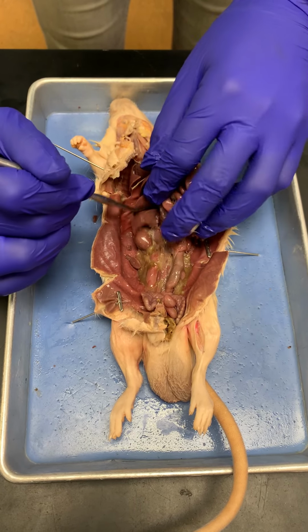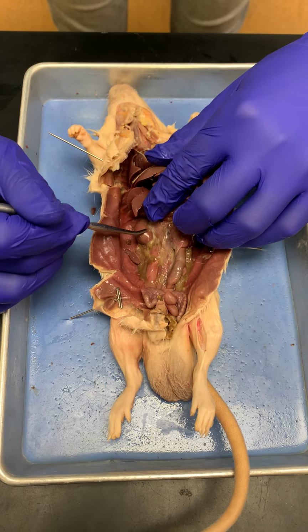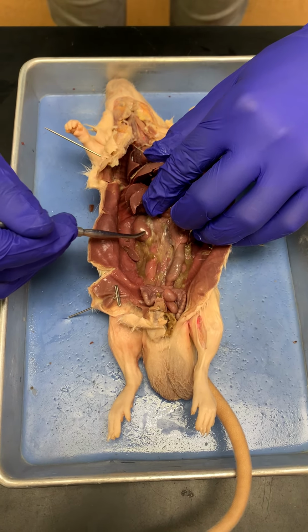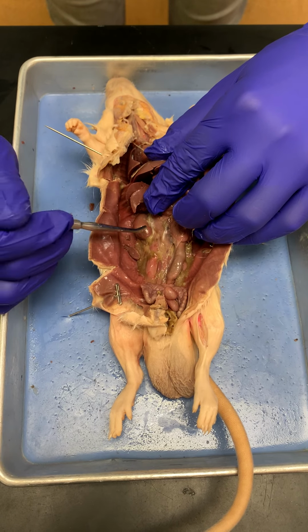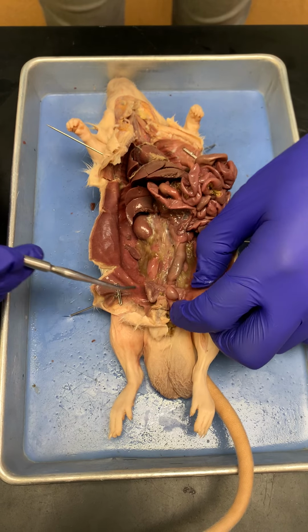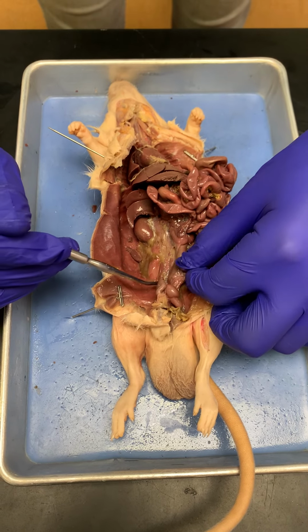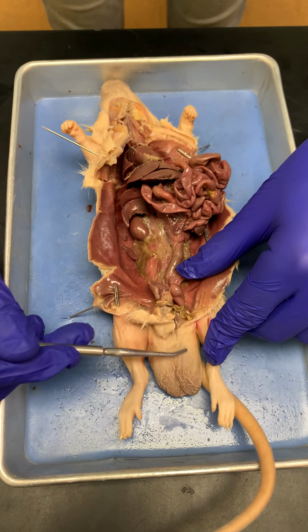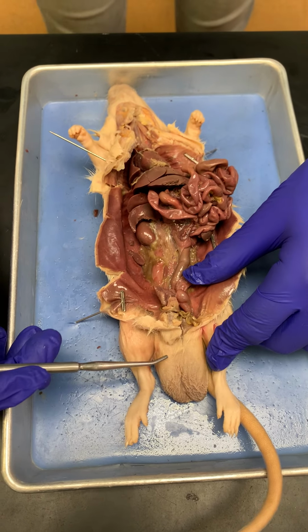And if we look, retroperitoneal, so that's what this is, the kidneys. So this is the kidney, they're bean shaped. Okay, so we also have these, known as the seminal glands, and then obviously this prominent structure here, these are his testes.